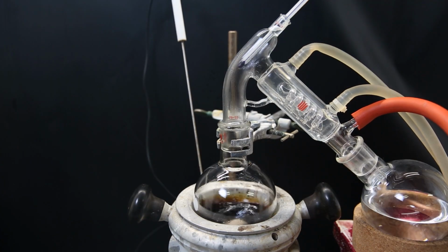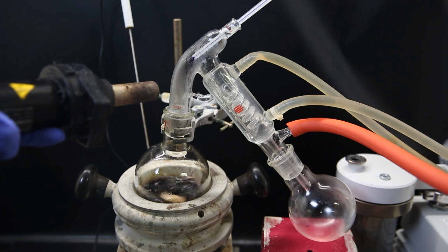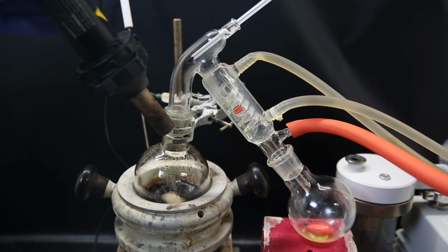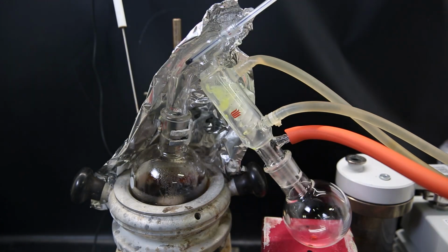When the ethyl acetate is gone, I swap the receiving flask and start pulling a strong vacuum. I increase heating and assist the distillation with a heat gun and start distilling over the various components. At first, the unknown yellow liquid distills over as the first component like before. When all of it had come over, I swapped the receiving flask and increased heating.